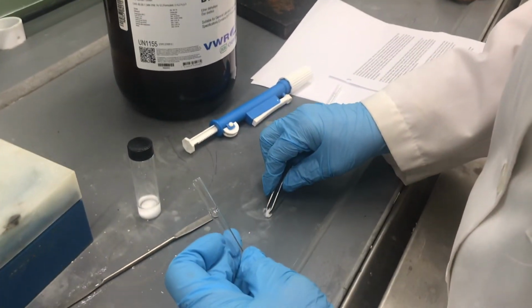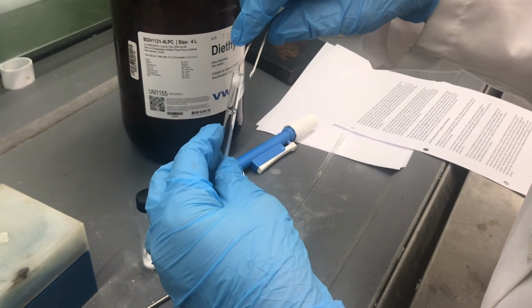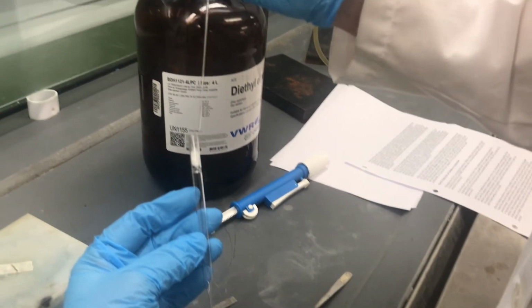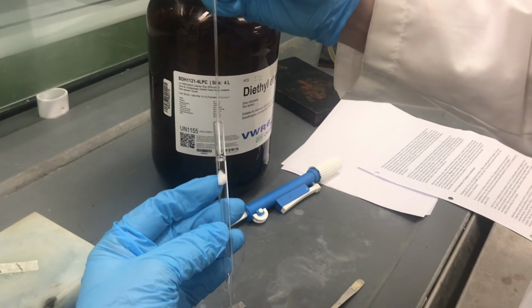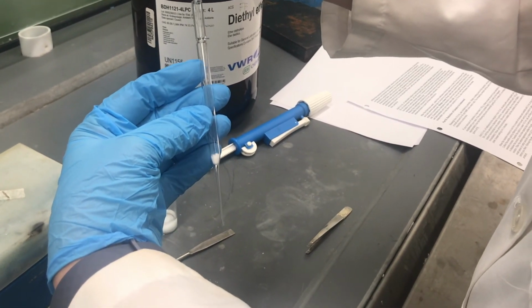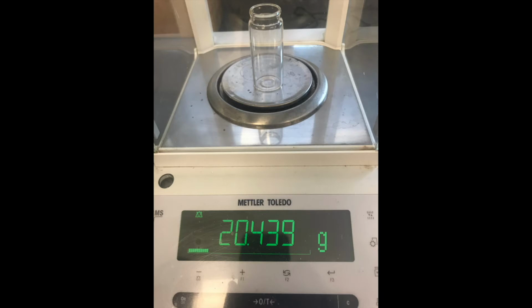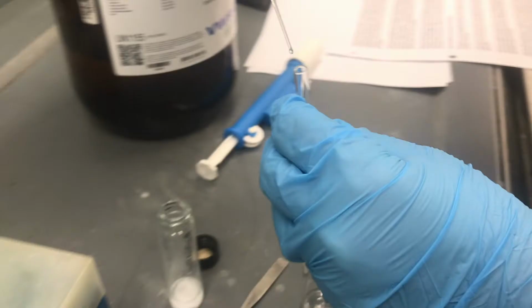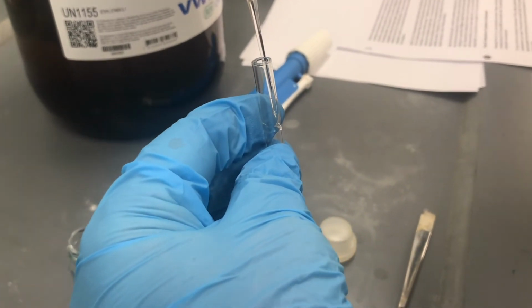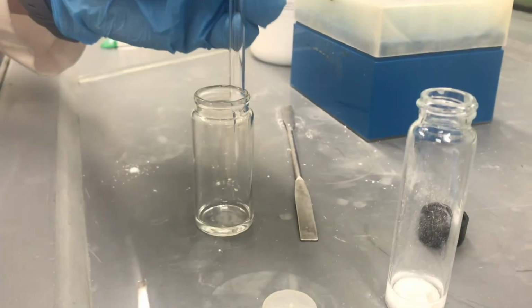Then place a piece of cotton into the bottom of a glass pipette. It'll be kind of like a funnel. Push it down with another glass pipette. So that's kind of going to block the mag sulfate and allow our product to go through. Pre-weigh your new vial, and then we will transfer our product, minus the mag sulfate that'll get held up by that cotton, through the glass pipette into our new pre-weighed vial.